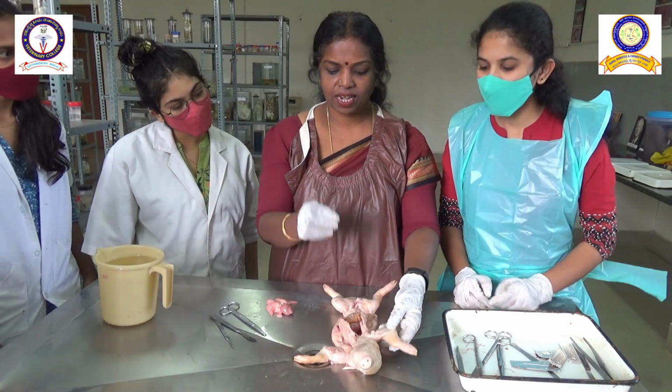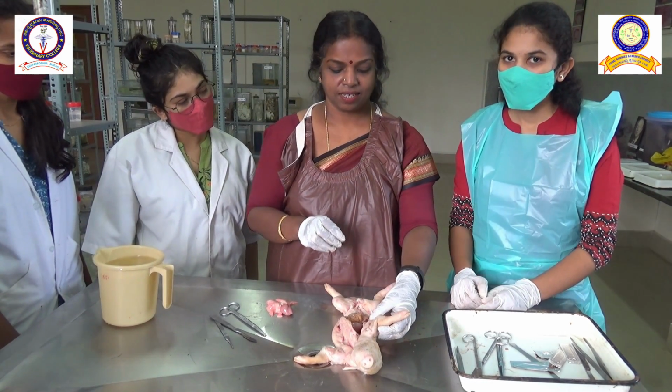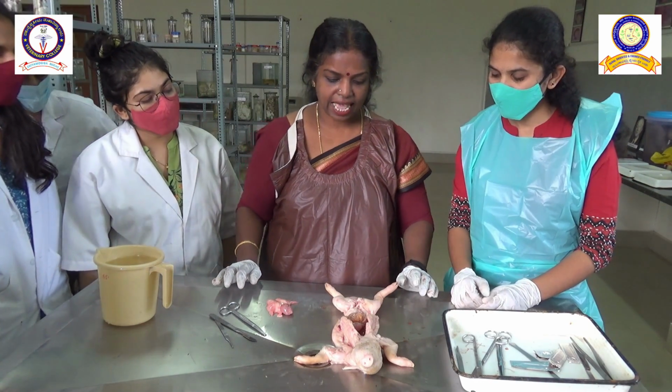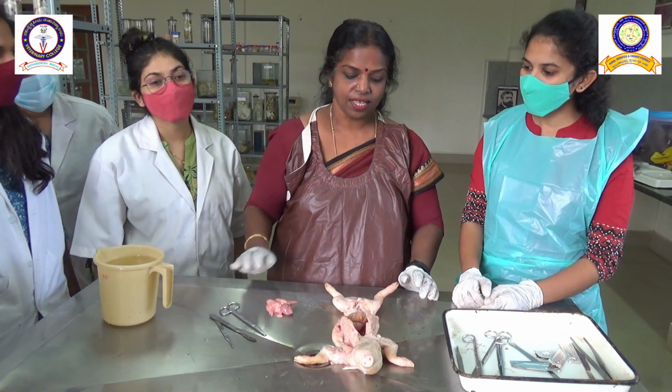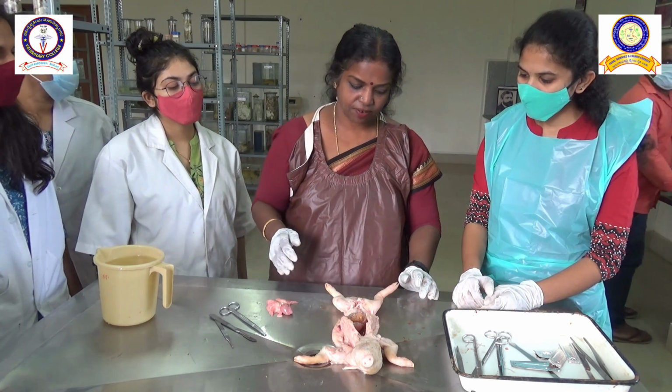Necropsy is one of the very important activities of the Department of Veterinary Pathology. Okay, so this is what we do. Investigation into the deaths that happen in various domestic animals and wild animals is done in this particular department. So today we have received a case.